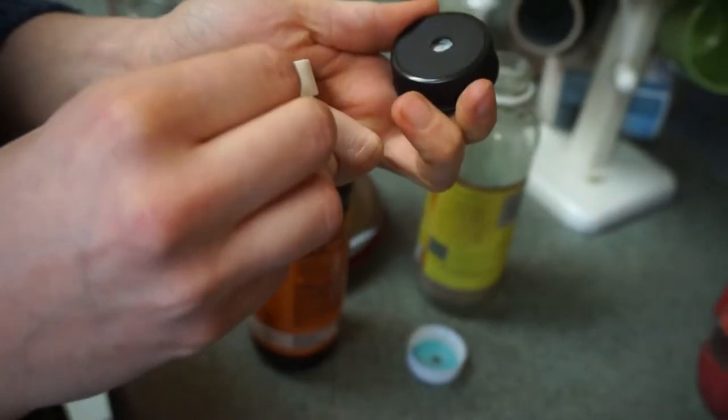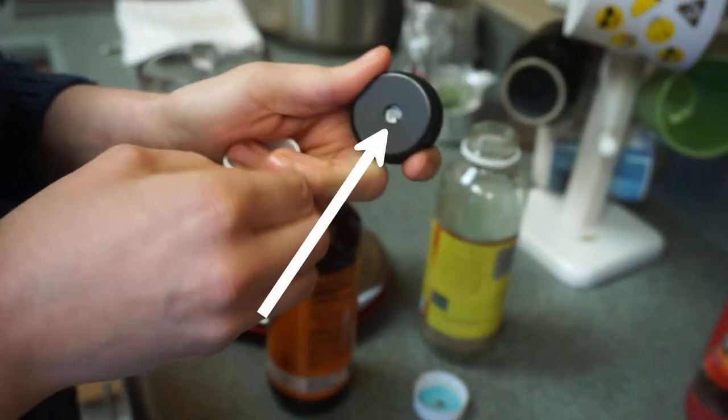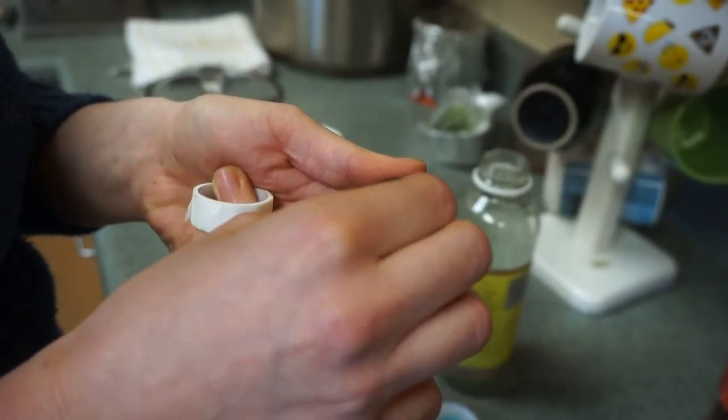In order to modify a glass bottle to be ready for agar, drill a hole into the lid and cover with micropore tape or stuffing.